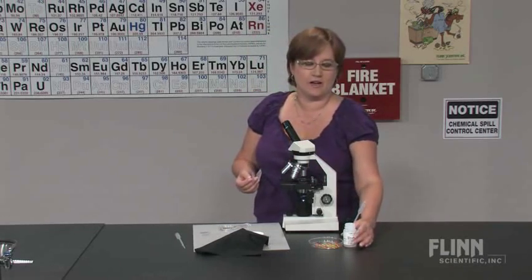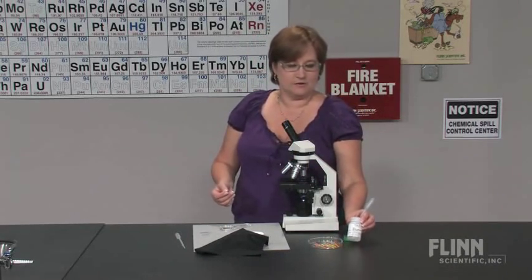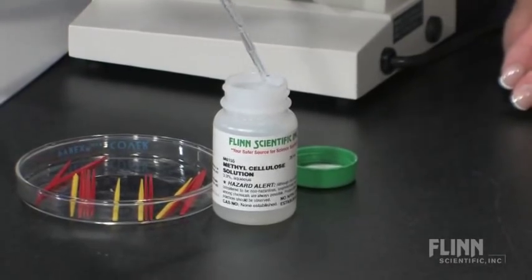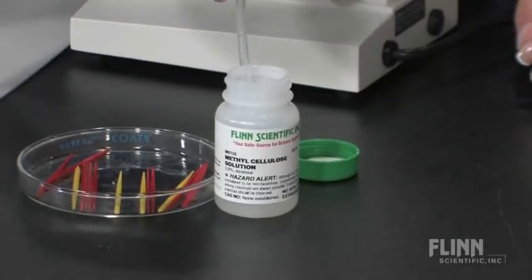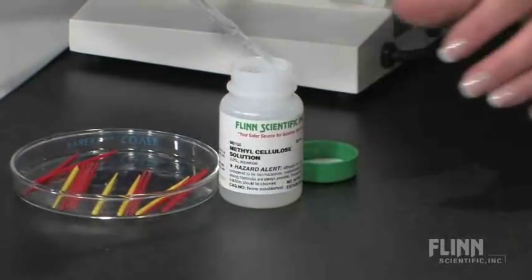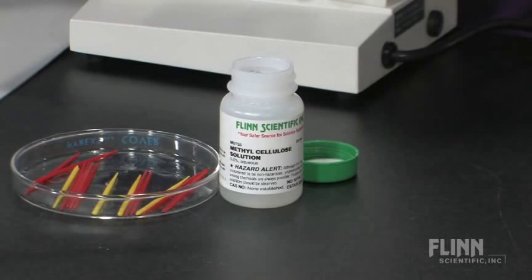Rather than do that, introduce them to methyl cellulose. This 3% methyl cellulose solution acts like petroleum jelly and they have to swim through this gelatin in order to be able to move.